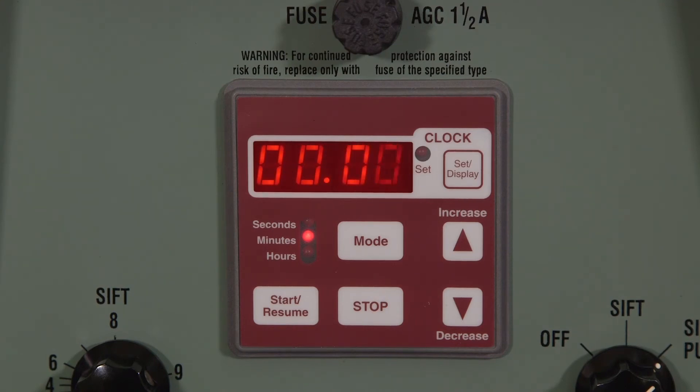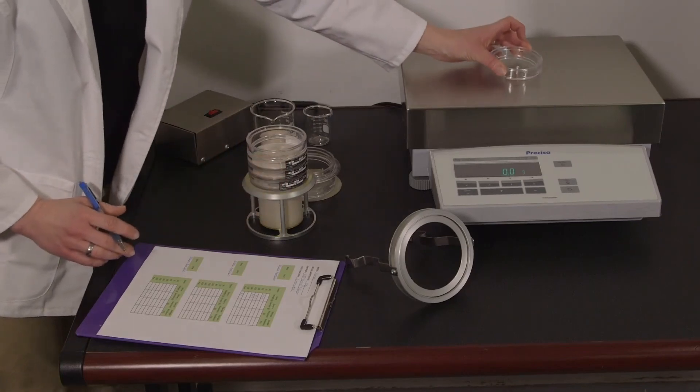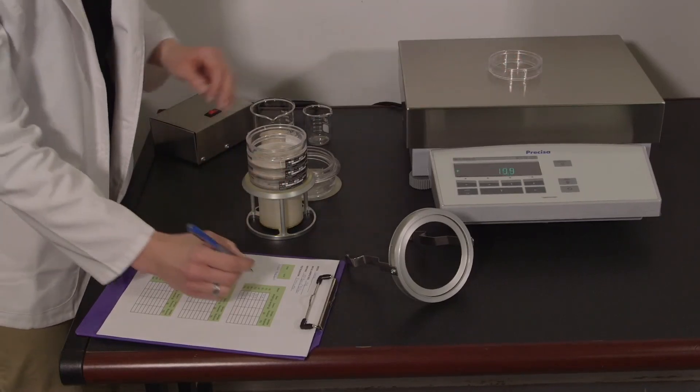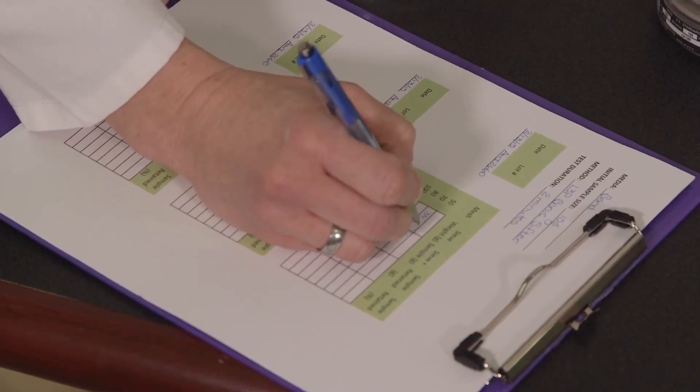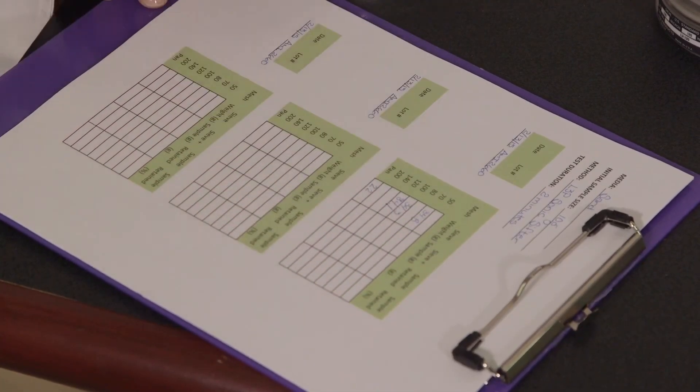Once the countdown reaches zero, the L3P will stop and the timer will beep indicating your test is complete. Carefully remove the stack, disassemble, and re-weigh the components. Record and calculate your results.